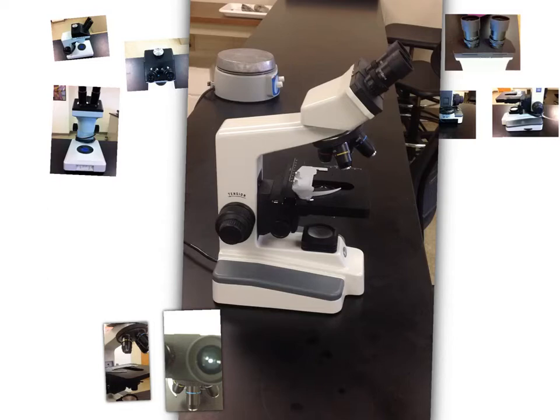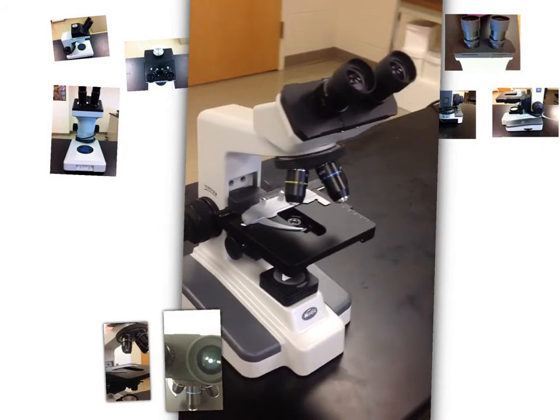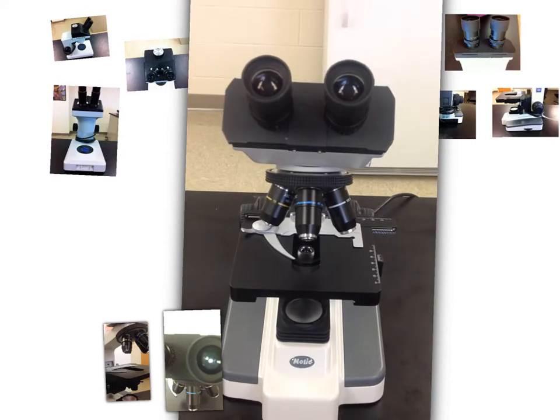Alright, so here we have our microscope. You guys take a look here. Here it is looking straight on. You've got your eyepieces. These adjust to the width of your eye. I highly suggest that you make sure that they are adjusted correctly. You can also turn them, depending on whether or not you need glasses, so they're going to focus. When you look through the eyepiece, you want to make sure that you are seeing one object. Don't just look through with one eye. You want to make sure you look through with both eyes.